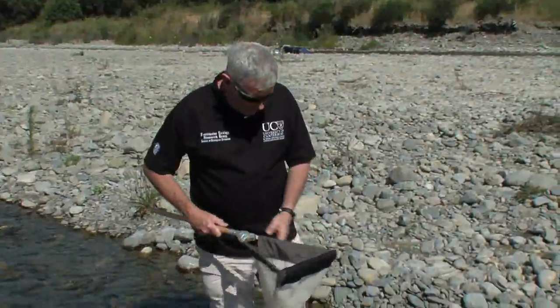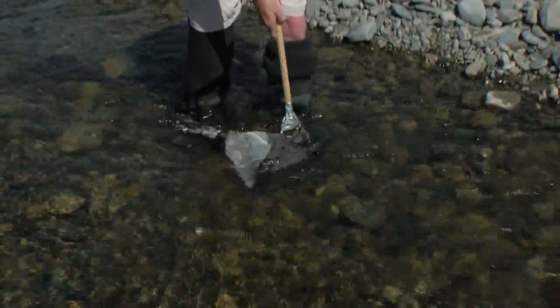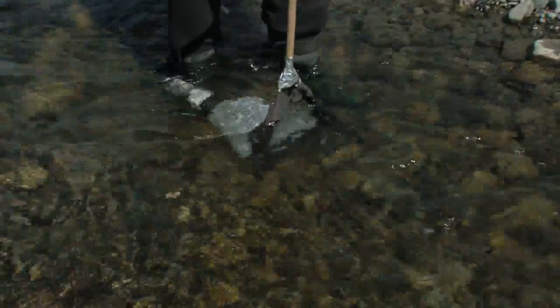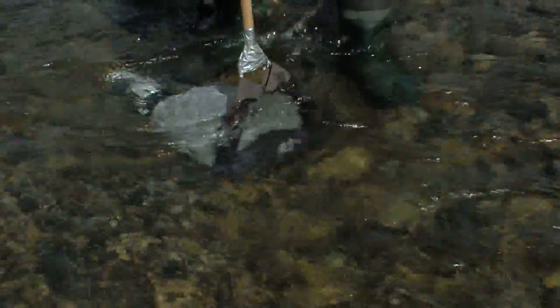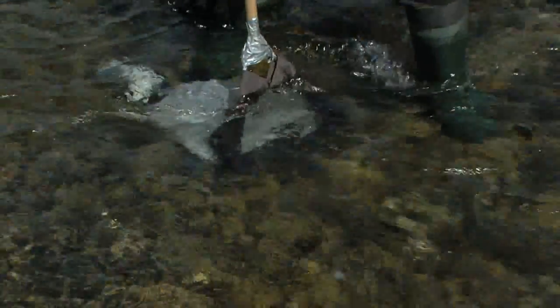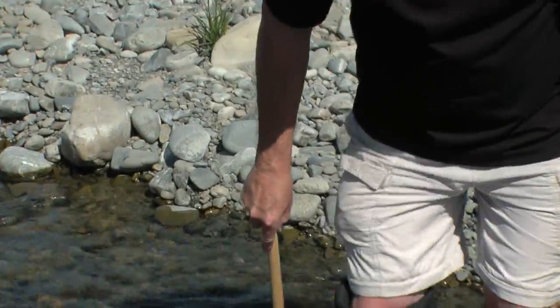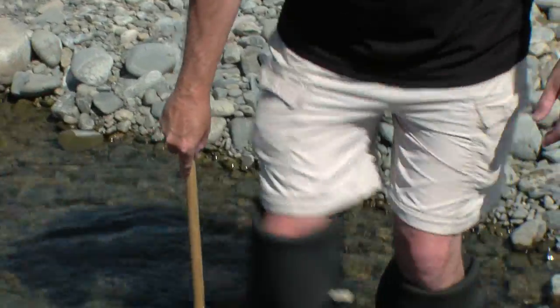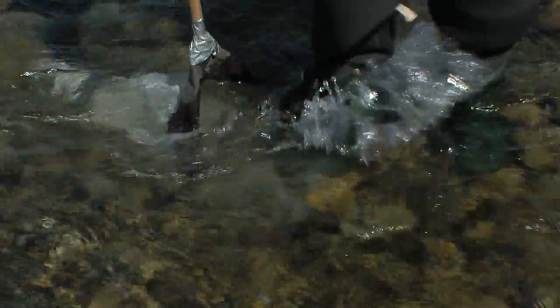The kicknet is placed pretty firmly down on the bottom of the stream bed. You can hold on to it by the handle here, and then all you're going to do is thoroughly disturb the substrate immediately in front of the net.